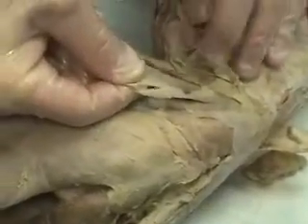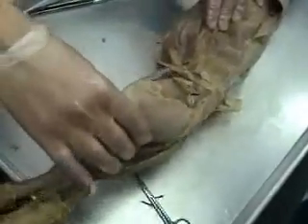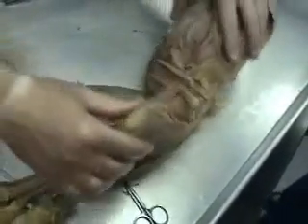It's not fully exposed, but there's the gastrocnemius and the soleus right below it, both attached via the Achilles tendon. The last couple of muscles — we've mentioned the sartorius. On the lateral side of the hip, next to the sartorius, originating on the anterior superior iliac spine, is the tensor fasciae latae — a relatively small muscle on the lateral side of the hip — that abducts the leg, pulling the legs apart, away from the midline. In that respect, it's an antagonist of those medial adductor muscles.